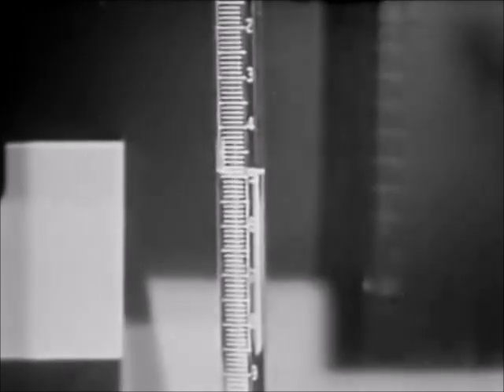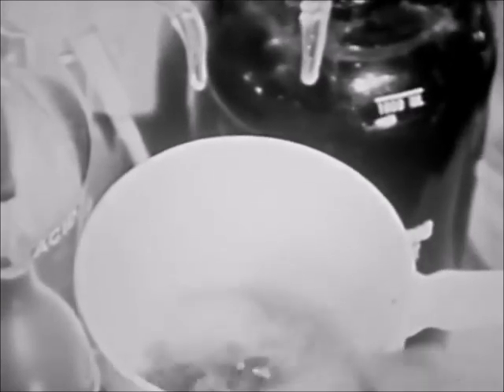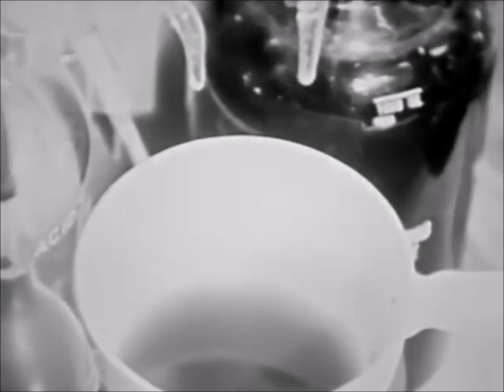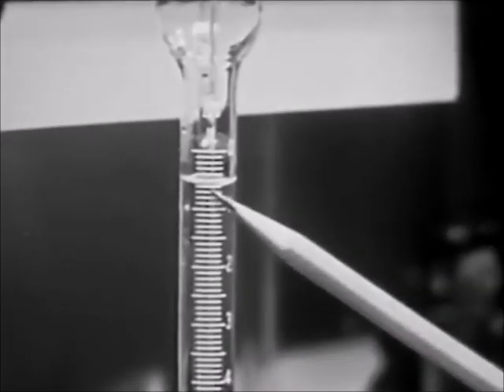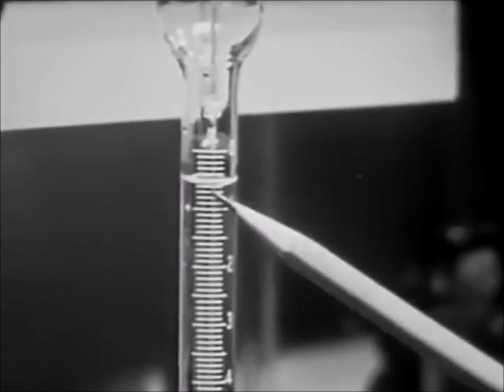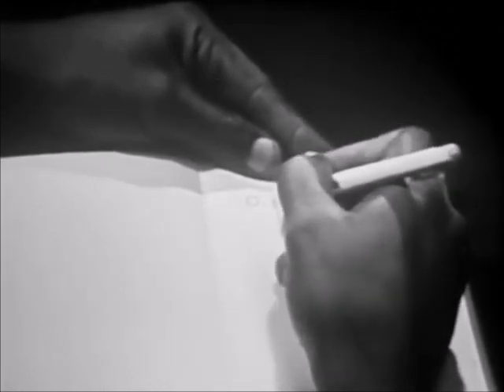You are now ready to start the mercuric nitrate titration. Stir the solution and add mercuric nitrate until the casserole contents just change to a blue, violet color. A faint blue color will first appear — do not mistake this for the blue, violet color. Read the burette: 0.6 milliliters, and log the quantity used.